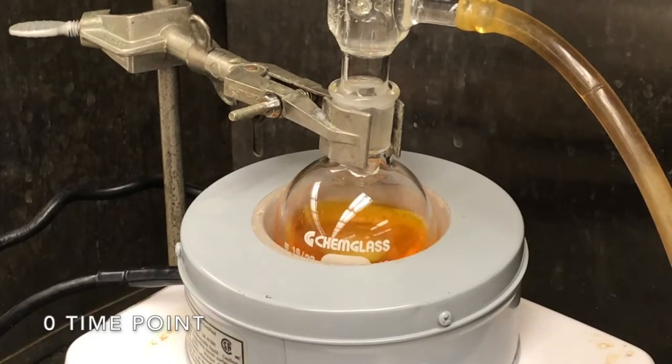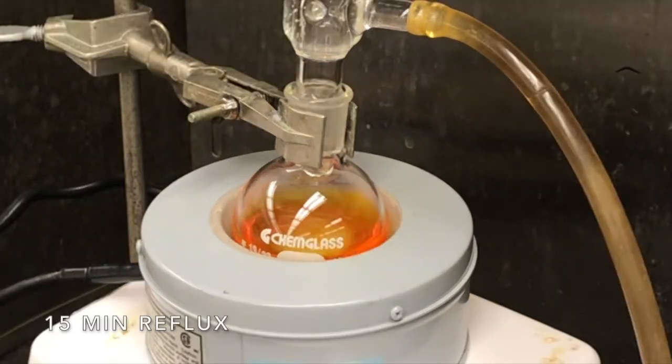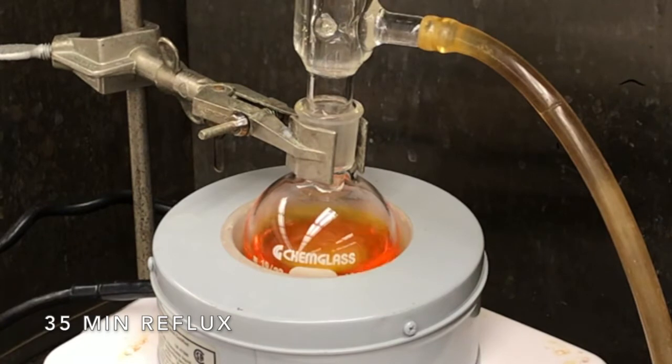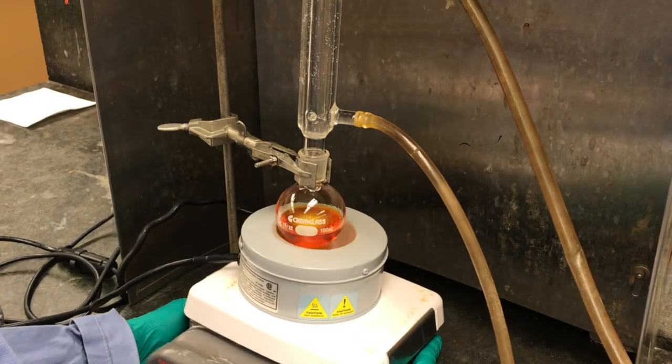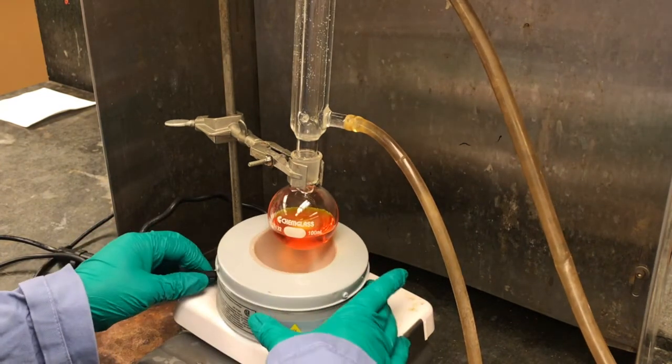Okay, so this is the 0 time point of the reaction. It just started to reflux. So make a note of any color changes throughout the reflux. We'll show you guys a couple time points, one at 15 minutes and then one at 35 minutes. So now our reflux is done. We're just going to take the heat off the reaction and then let this cool to room temperature.